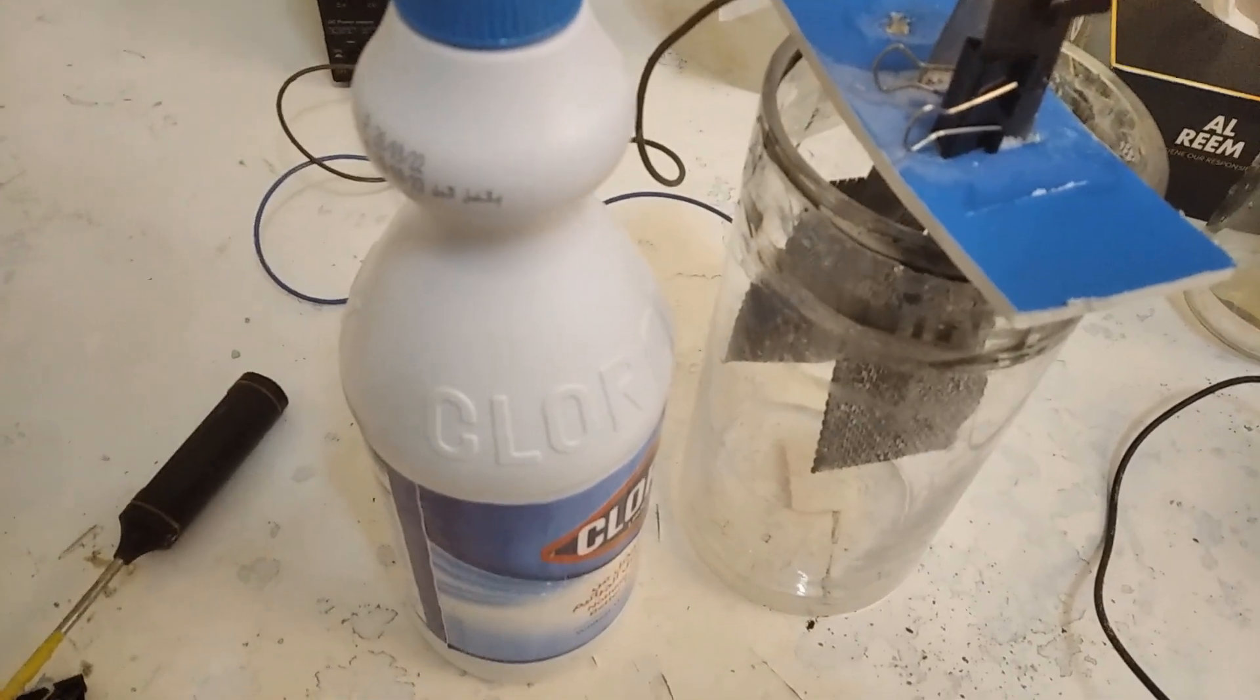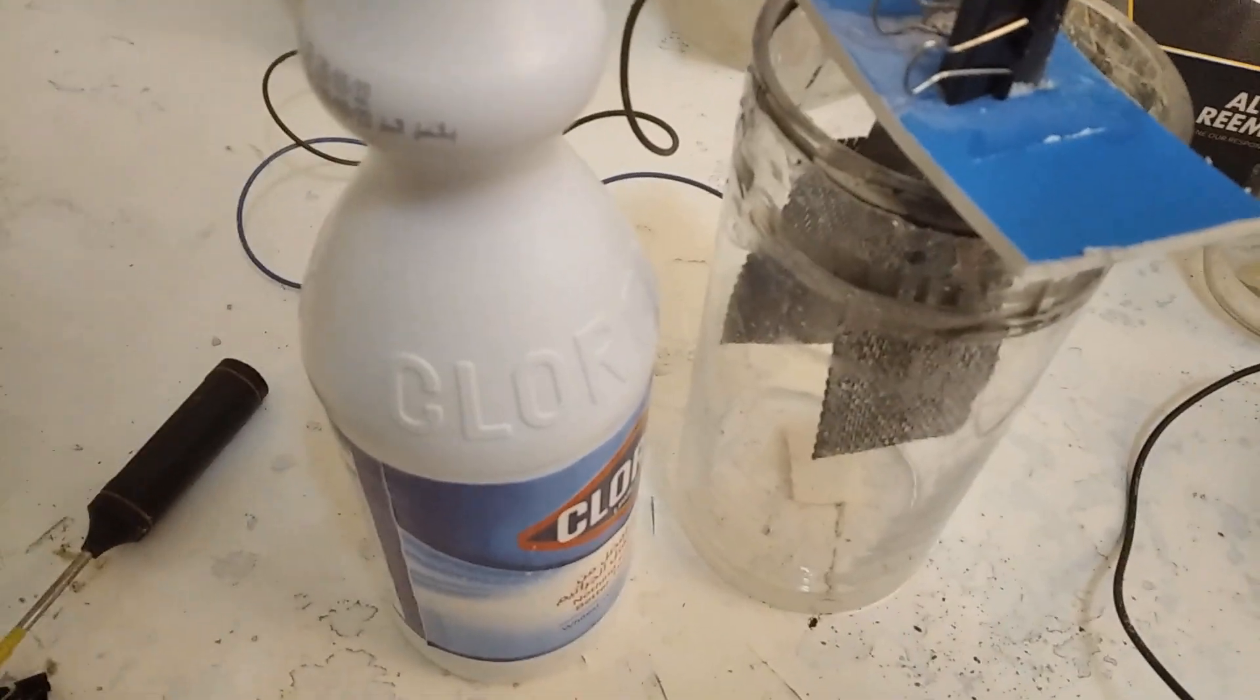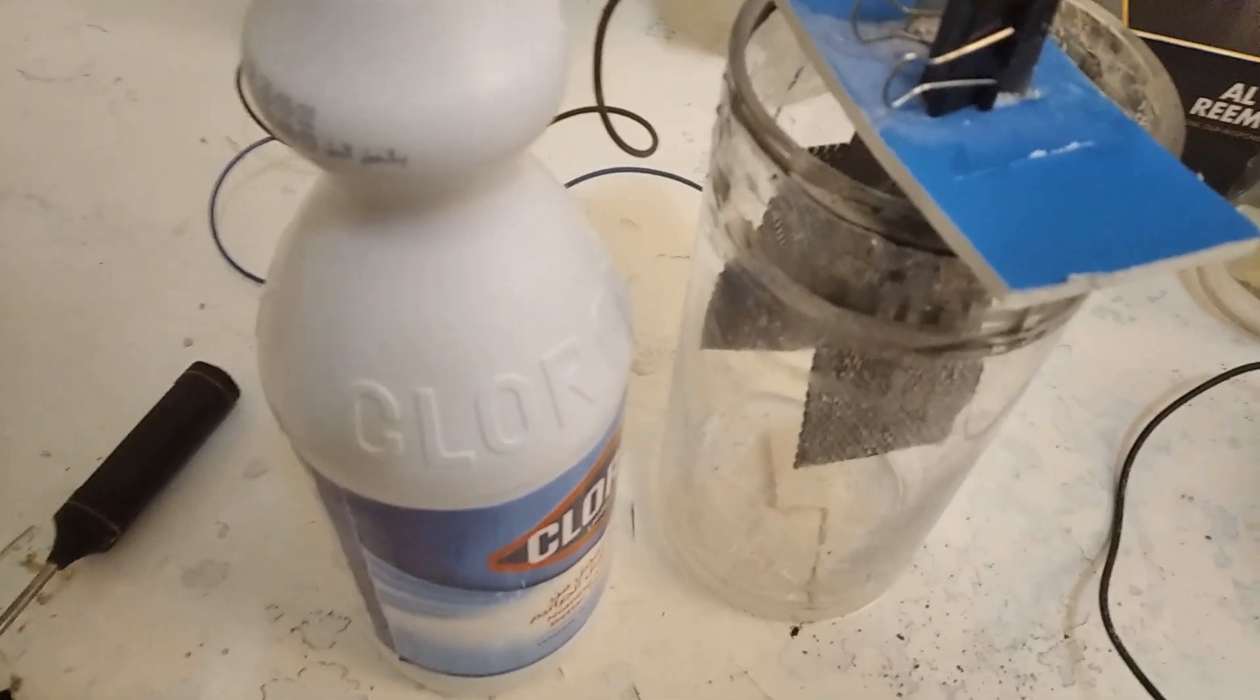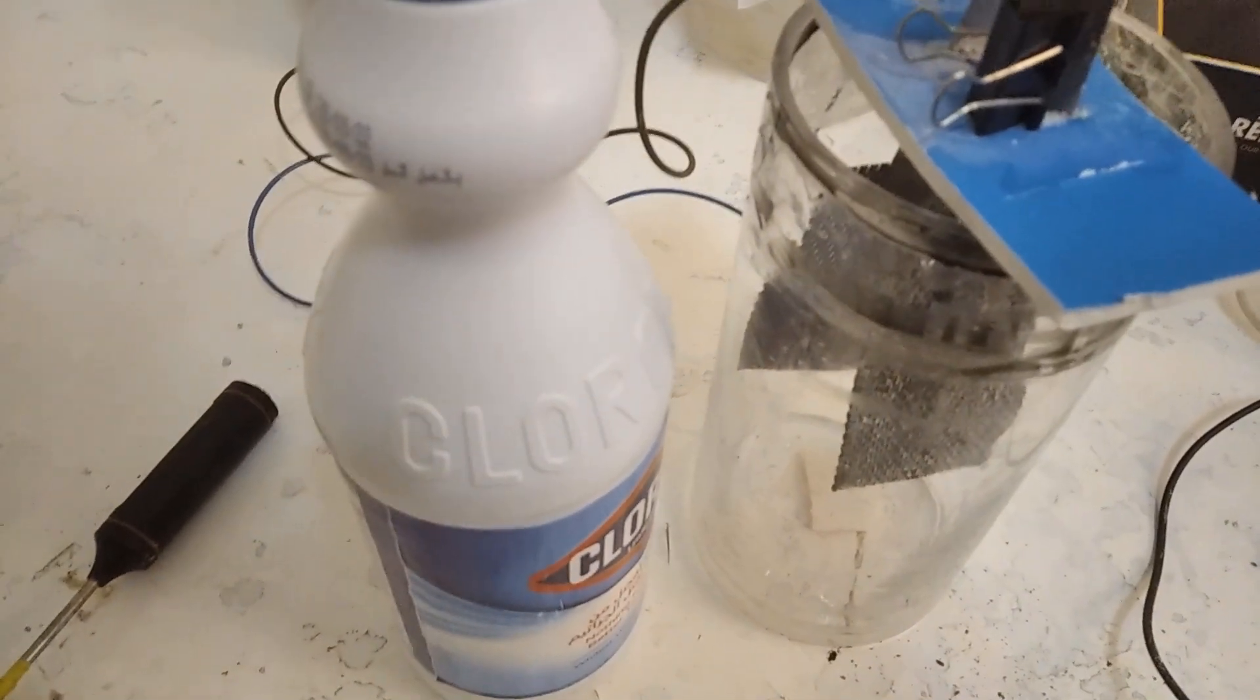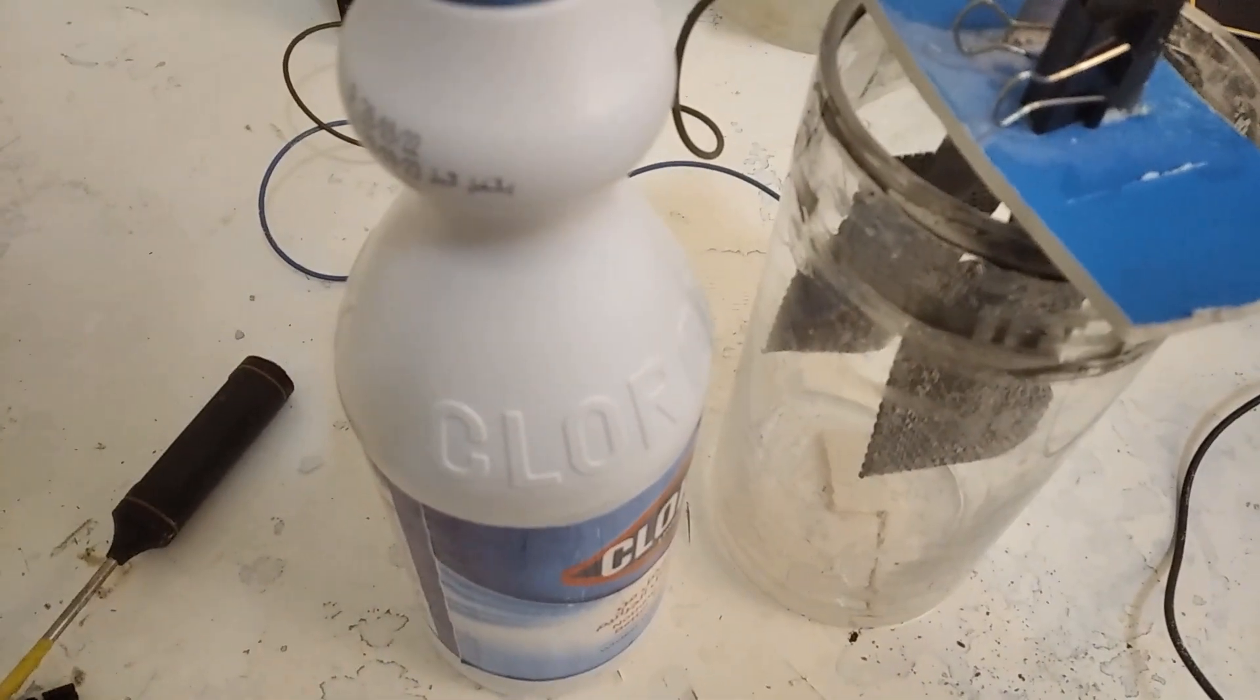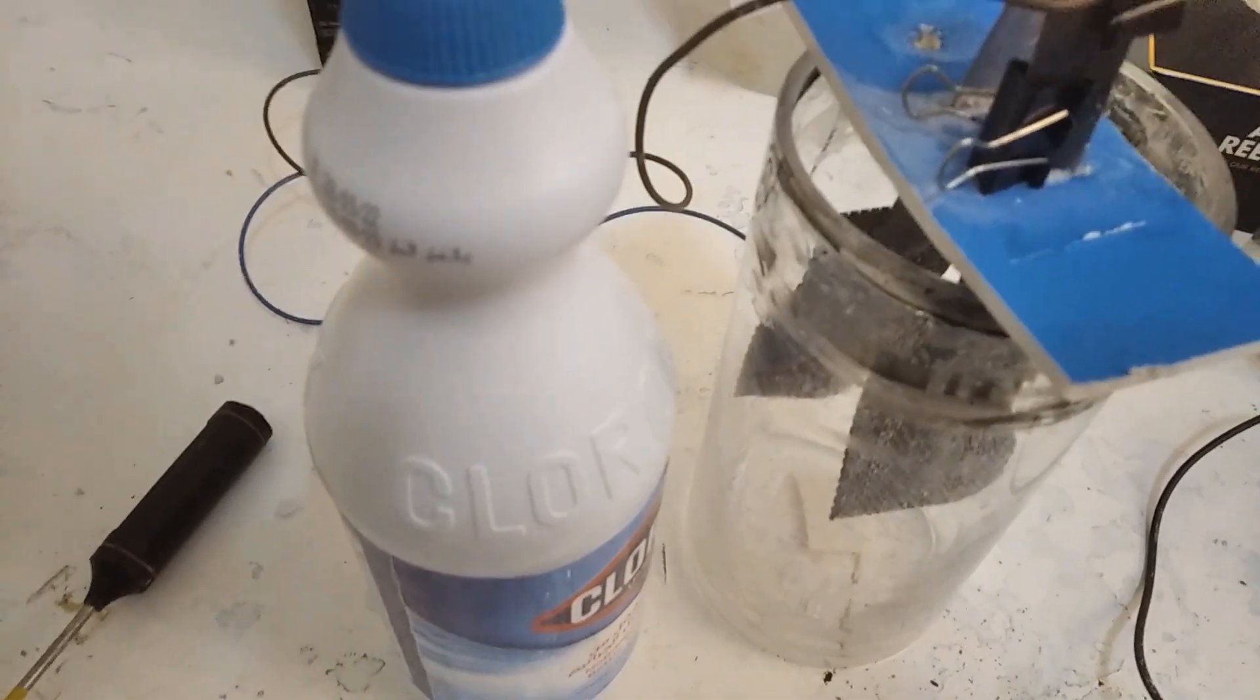So let's see if it works, whether or not this is enough to protect. Essentially I'm going to be electrolyzing bleach instead of a saltwater solution. I'm also going to mix extra salt into bleach to add more chloride ions into it, and hopefully this works out.